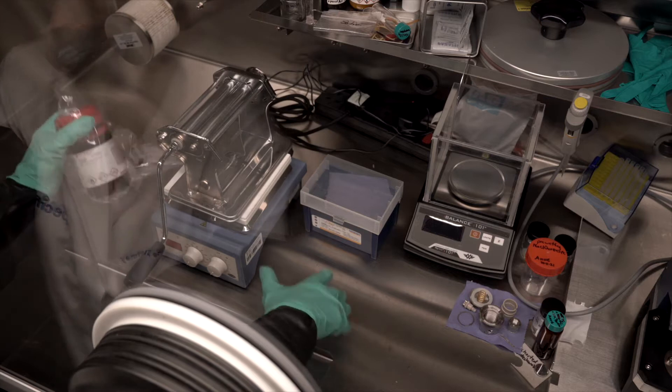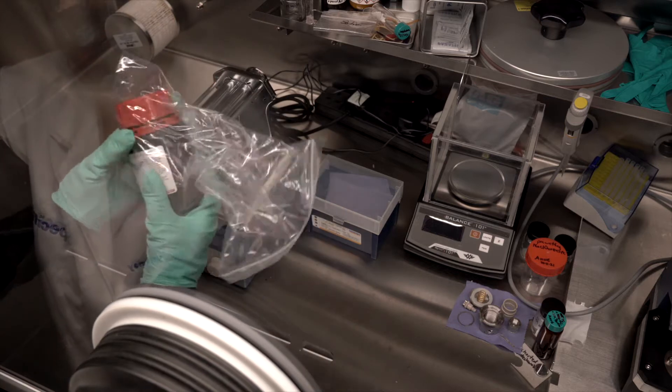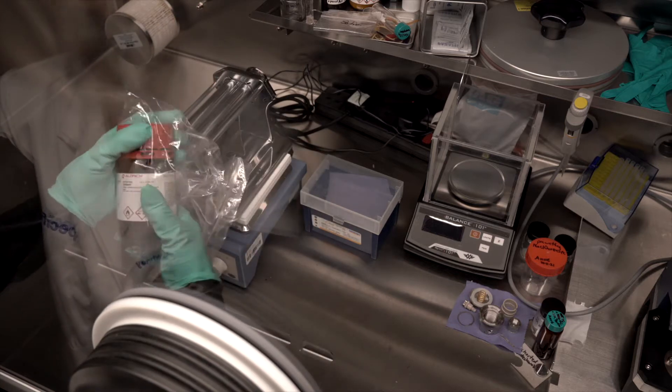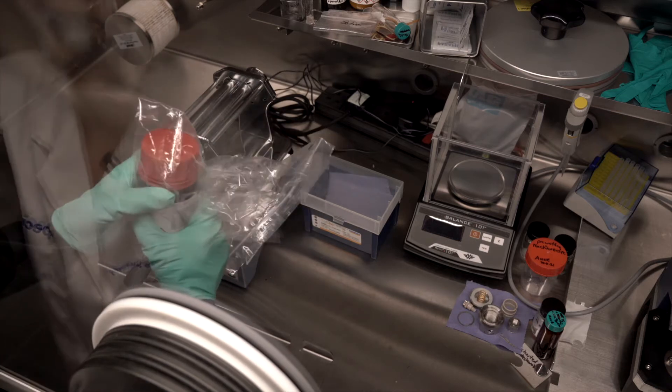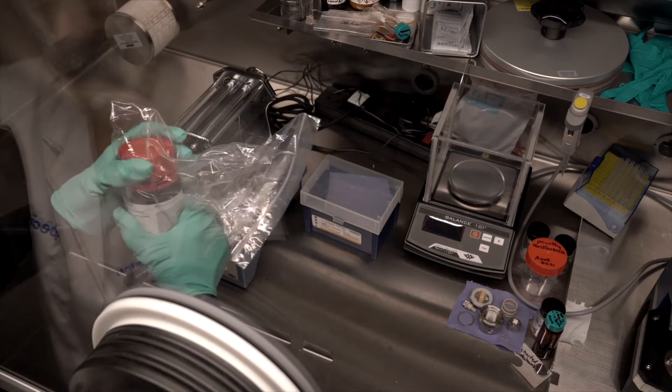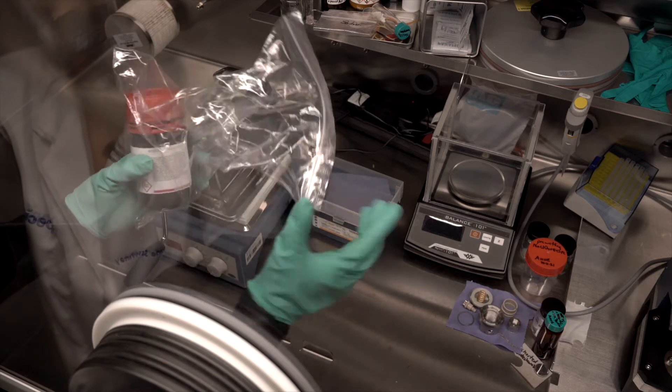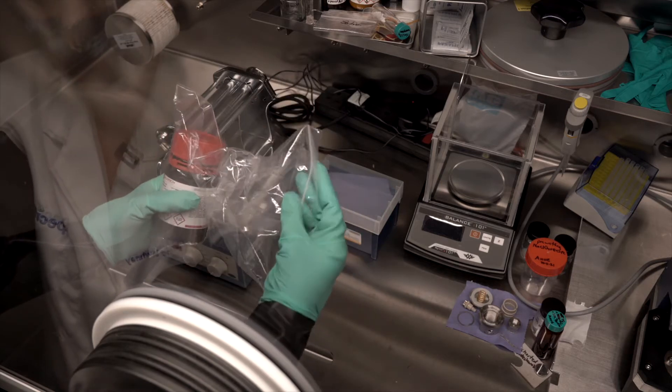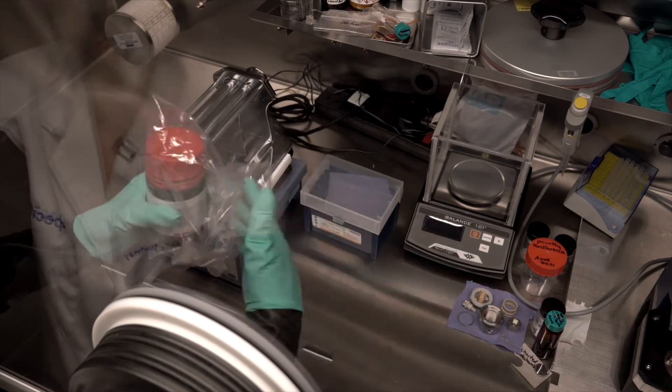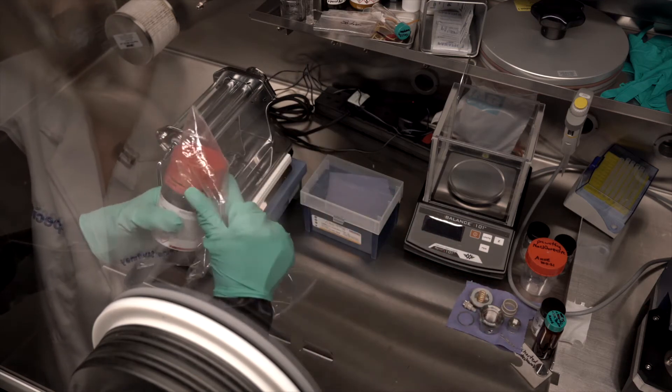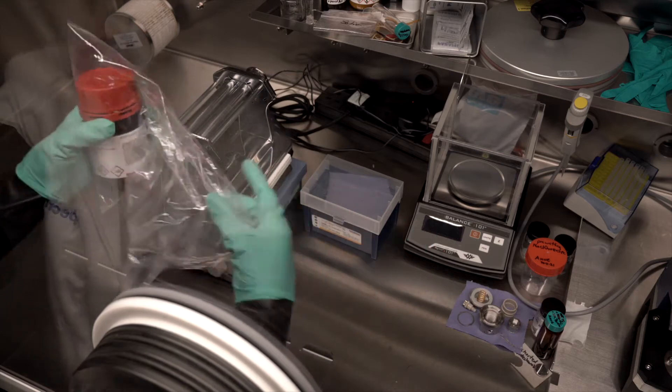Now, if your sodium arrives in a large canister, you also want to make sure before you open that canister that it's been sealed in an inert environment, obviously. This one I keep sealed in my own bag and if when you open the bag you recheck the water vapor and it's gone up, well, then you want to wait for it to get filtered out.